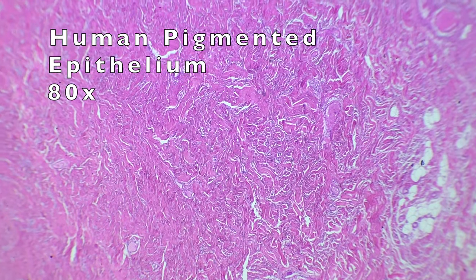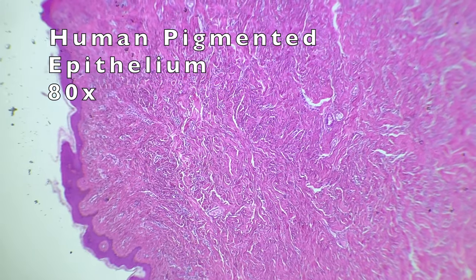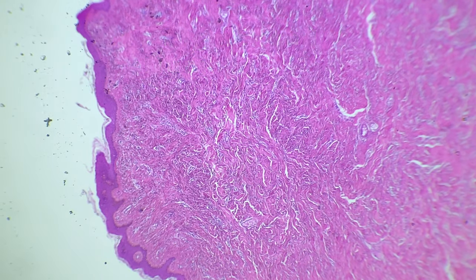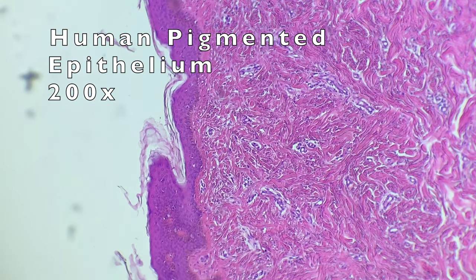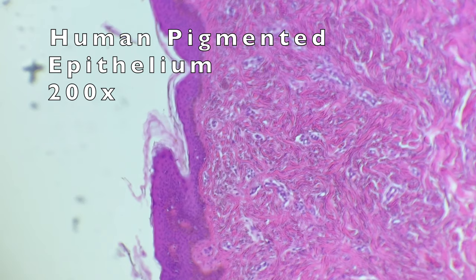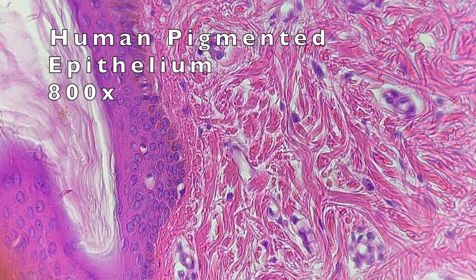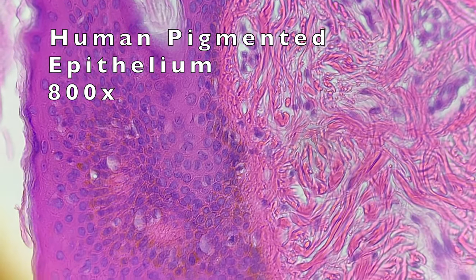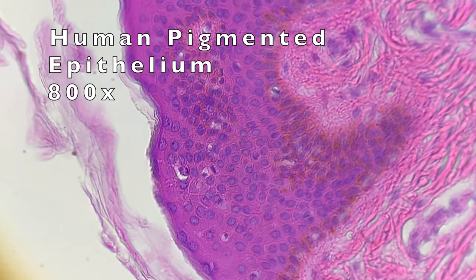Here is our mystery photo from the beginning — pigmented epithelium, which is just simply another way of saying this is your skin that we are looking at. The darker outside portion is where the darker pigment resides, so the stain used on these slides reaches a much deeper color when it mixes with those cells.